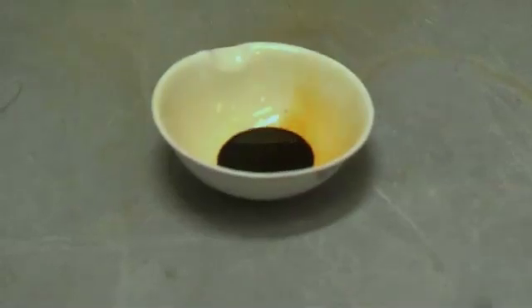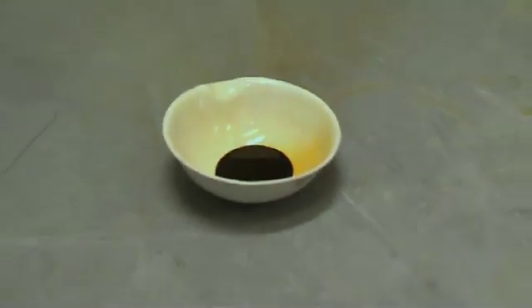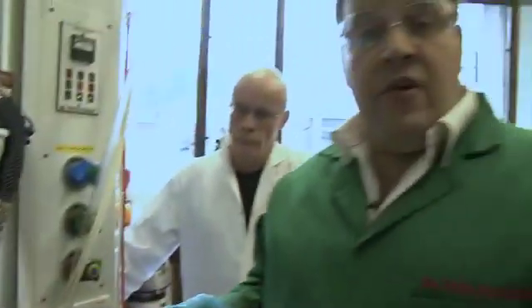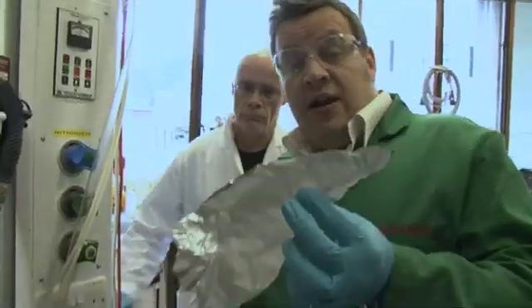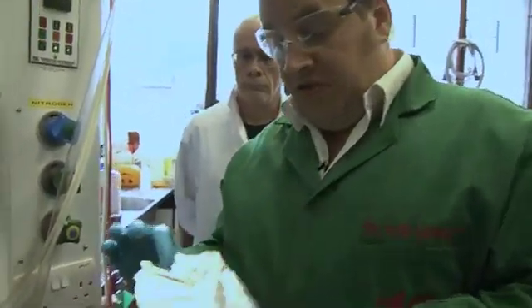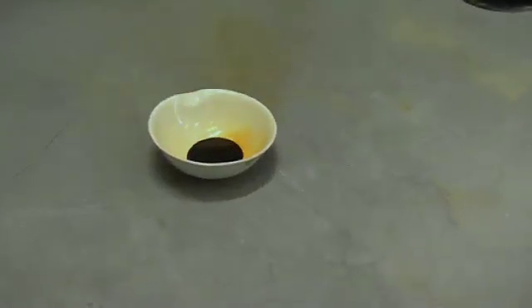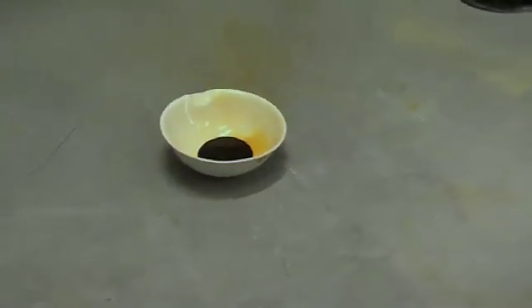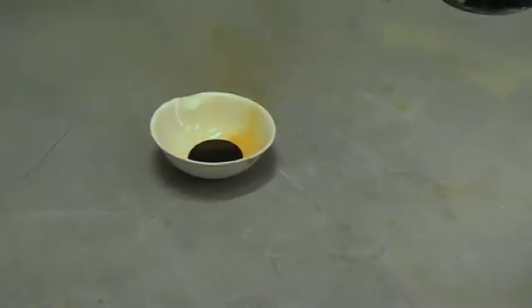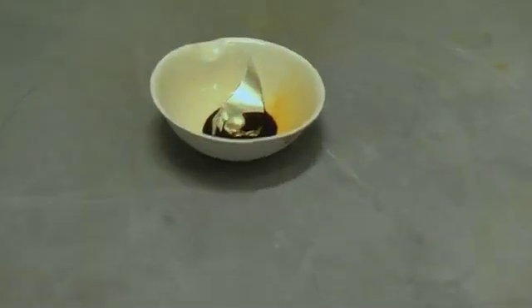Bromine itself is strongly oxidising, so we thought we'd do an oxidation reaction today, and that reaction is to take another element — and here we have aluminium, simple aluminium foil, like you wrap your dinner in. We're now going to put some small amounts of aluminium foil into the bromine liquid.